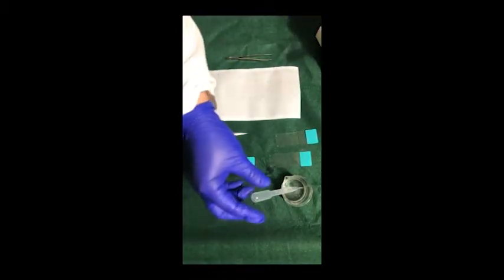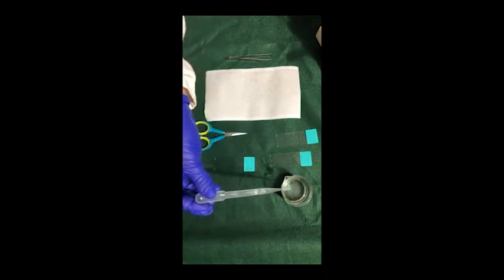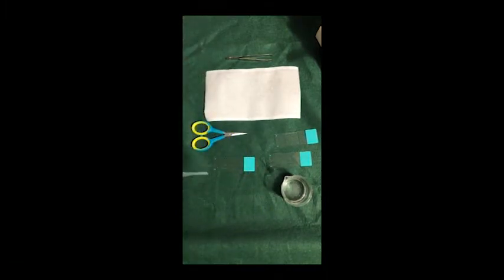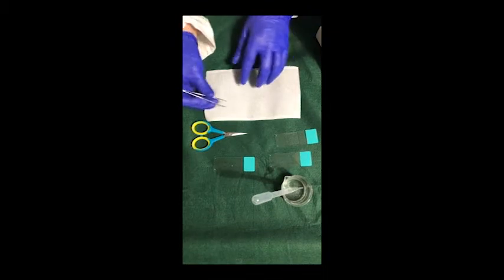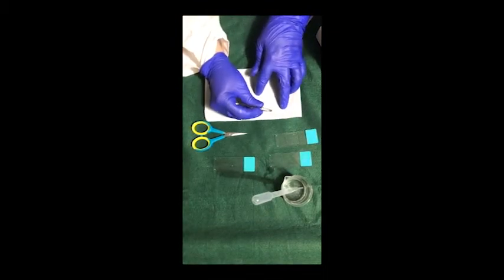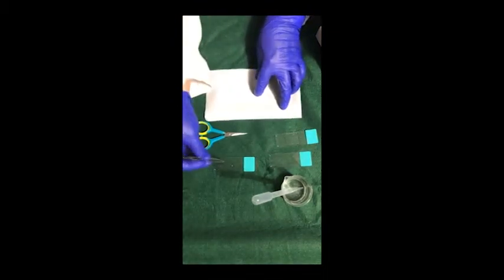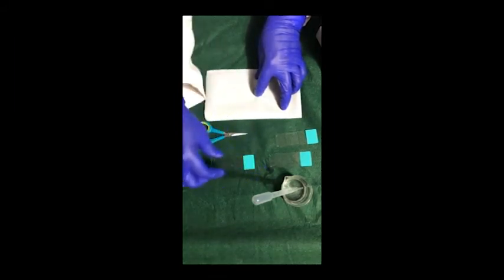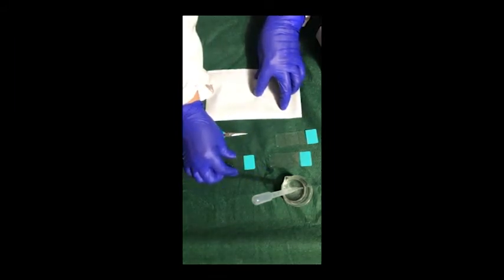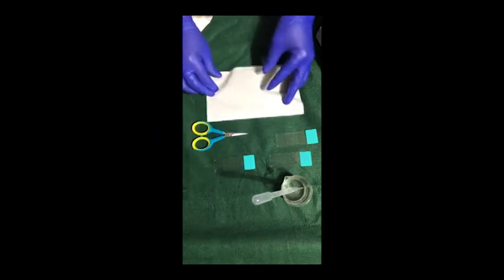The first thing we need to do is make microscope slides for our fiber samples. Today I will choose three fibers from the lint roller sheet and make three slides to observe. I will first put a drop of water on my slide, then select a fiber to place within it and cover it with a coverslip. The water will help light pass through the specimen more evenly. If the fiber is too long for the microscope slide, you can cut it to better fit.